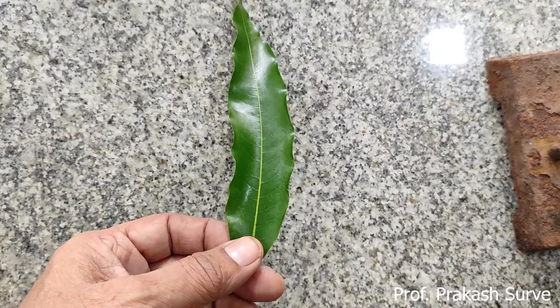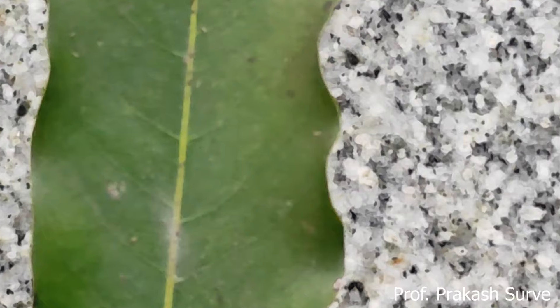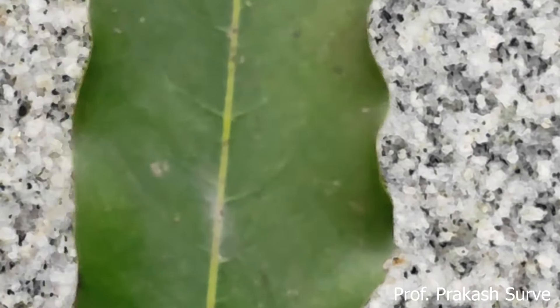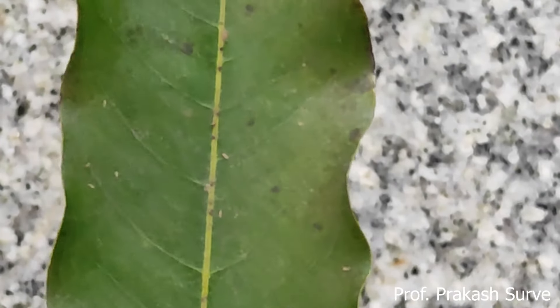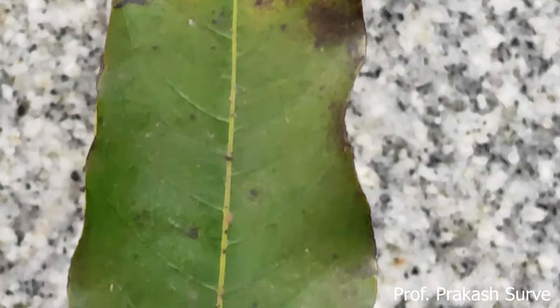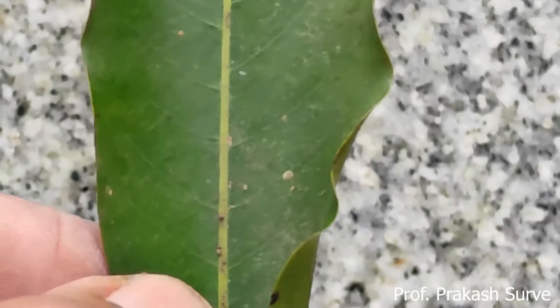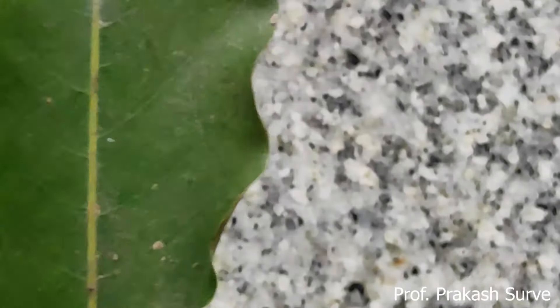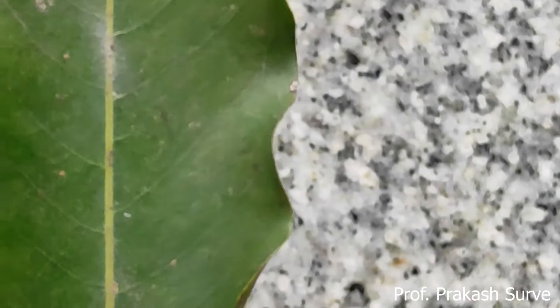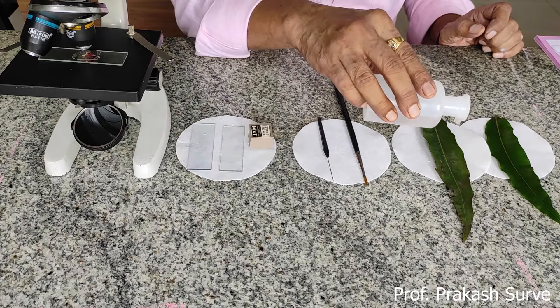Now we will look at the unwashed leaf, on which we can observe that so much dirt is present. Many dirt particles are present — some spores may be present, some pollen grains may be present. Some insects are also there, many microscopic particles are present, and some microbes may be there. We can even see a small web on this leaf.